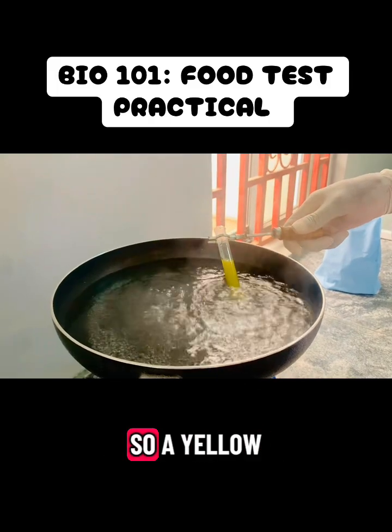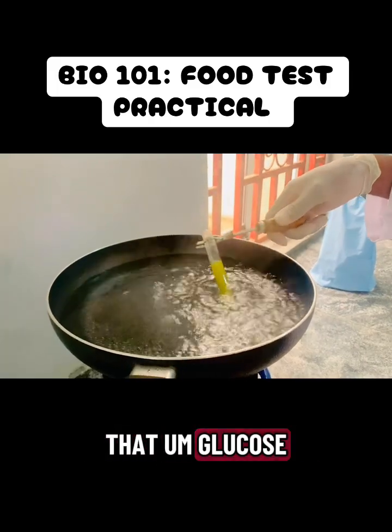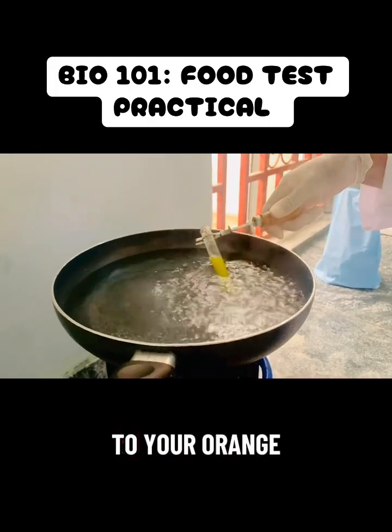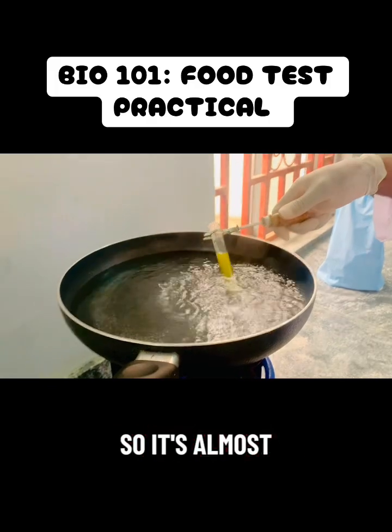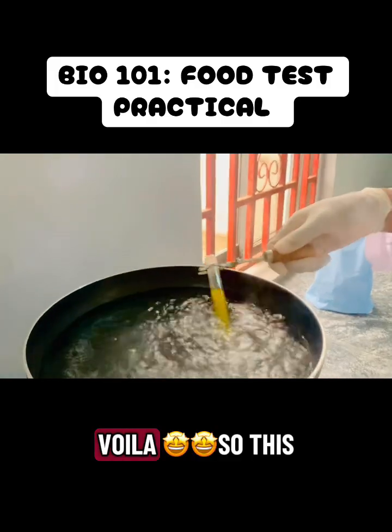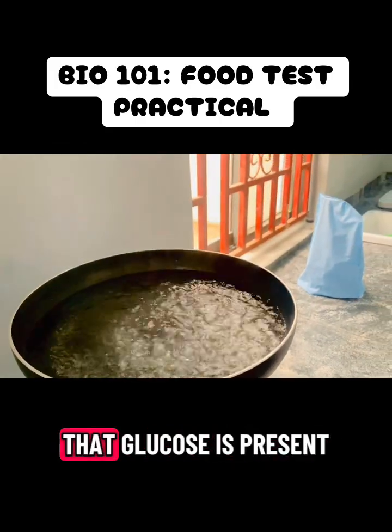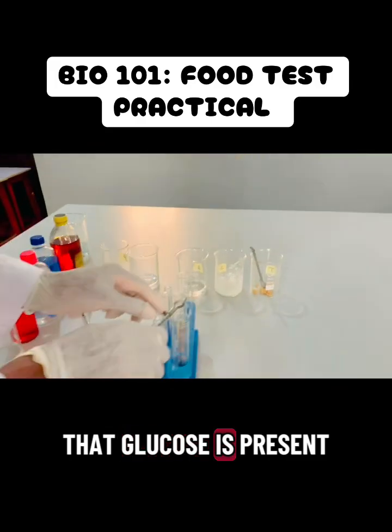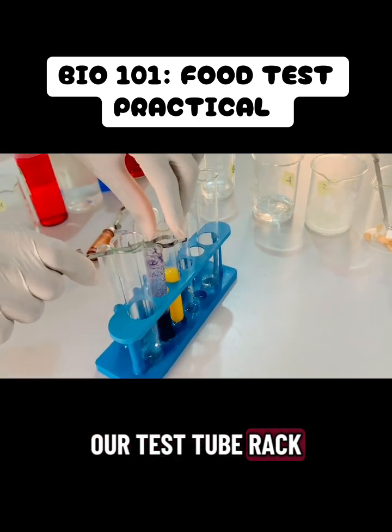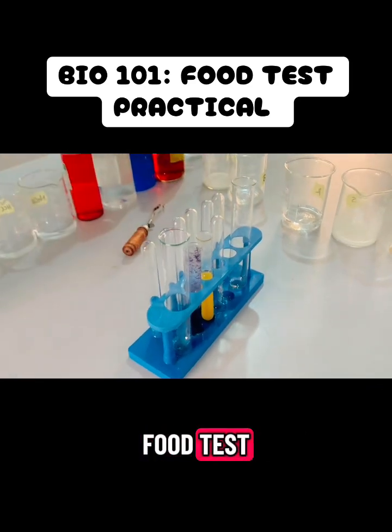Yes, yellow. A yellow precipitate or yellow color change shows that glucose is present. Some people can get till orange, so it's almost tantamount. So this is it. Voila. This color change indicates that glucose is present, and then we put back our test tube in the rack and get ready for another food test.